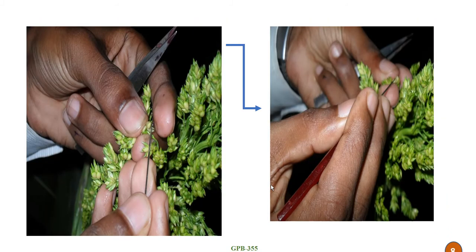Then after selection, remove the upper part which is likely to be mature, and also the lower immature part, and select the part in between of the panicle, where there is maximum chance that the anthers are immature, and by using the forceps remove the anther from each floret. So this is a tedious job.